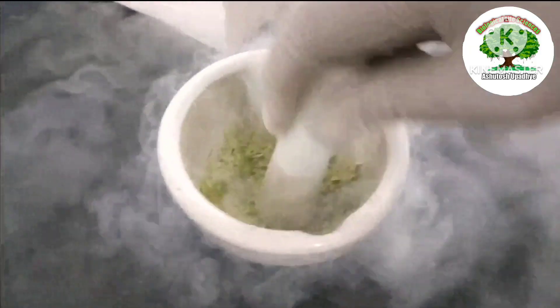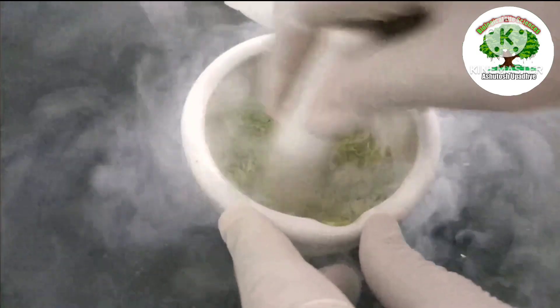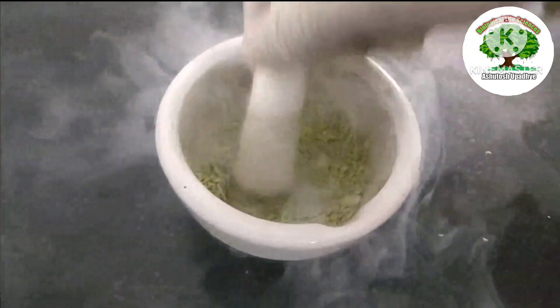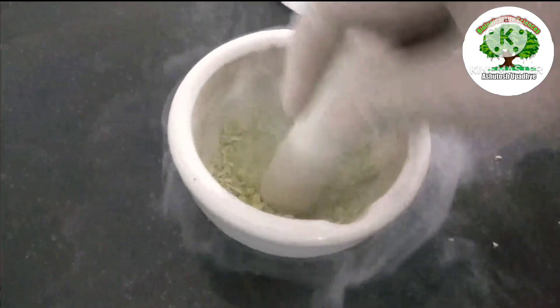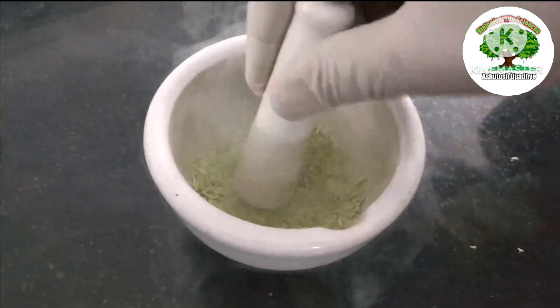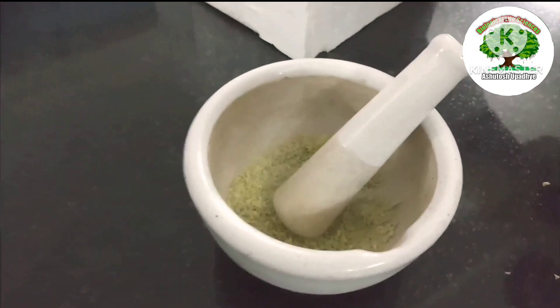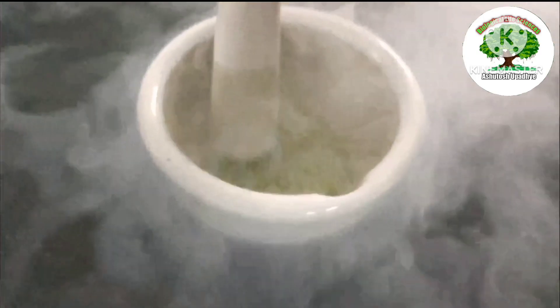The sharp crystals bring about the homogenization of the whole tissue and convert it into a very fine powder. This fine powder is very important as it is easy to use in DNA isolation and other protocols, for example isolation of chlorophyll and other components. Therefore, liquid nitrogen homogenization is very helpful. You can see while adding the liquid nitrogen we are crushing the leaf sample and it is giving us a very fine powder which is easy to use.